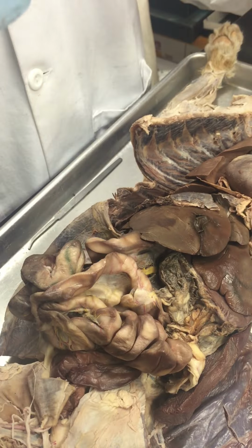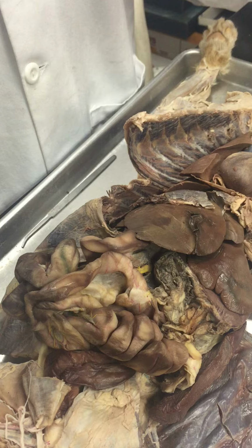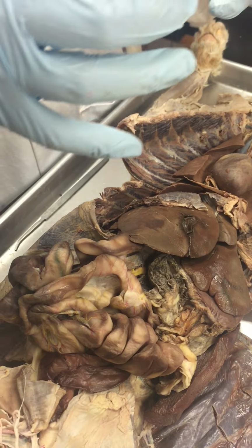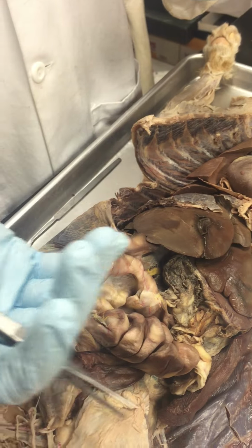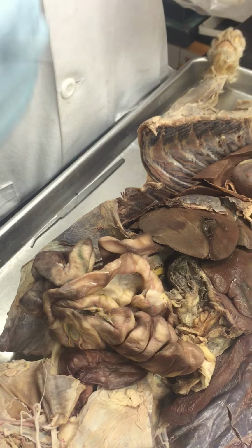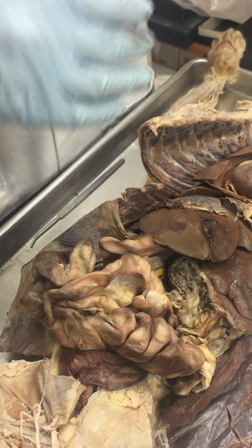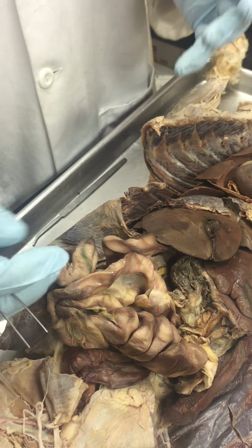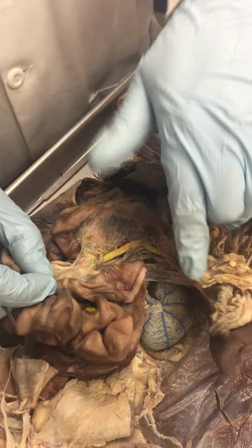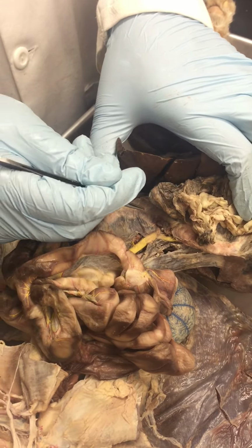So you have blood supplying this system, and you have nutrients that are absorbed in this region, and once it's nutrient rich, the blood returns to the liver first, because most of the nutrients you absorb it needs for processing or to redistribute. So it goes through a vein system which is stained yellow here. It's called the hepatic portal system.